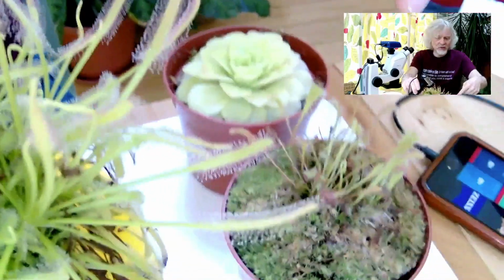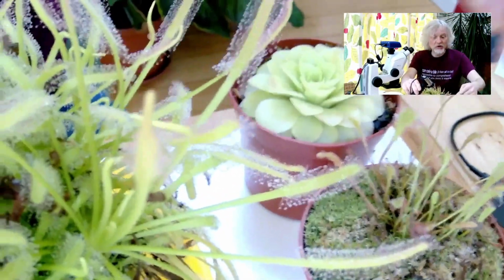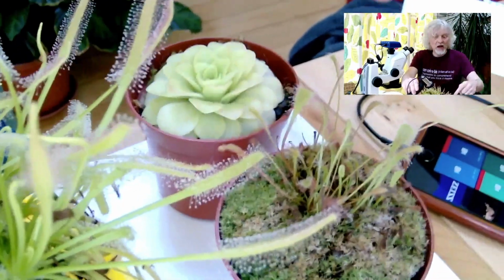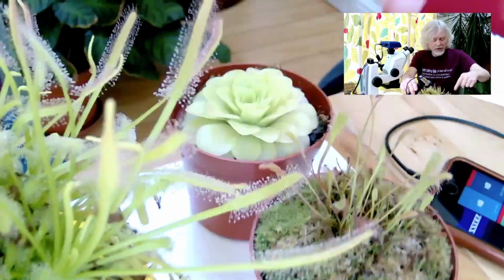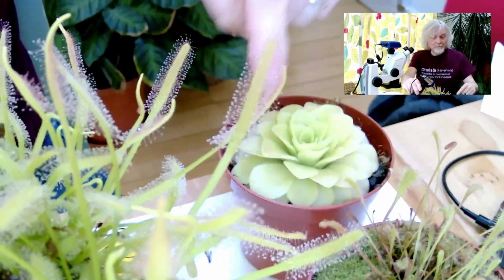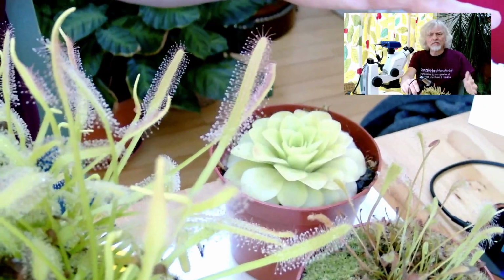I've got another slightly more sickly looking one, which is quite pretty under the microscope, which I wanted to show you. This one is also from South Africa, and this one is called Drosera nidiformis, it doesn't have a common name, and I'll tell you why I'm going to show you that one later. And then this plant here, well, in fact it's not really related, but it's similar, and you'll see why later on. So, okay, I'll put this back down here.